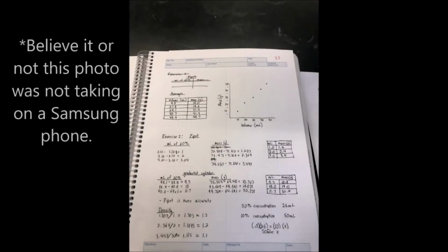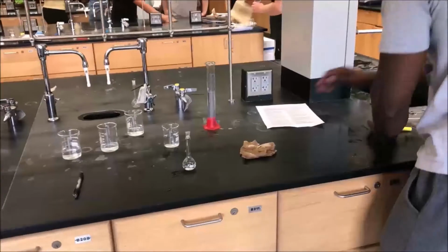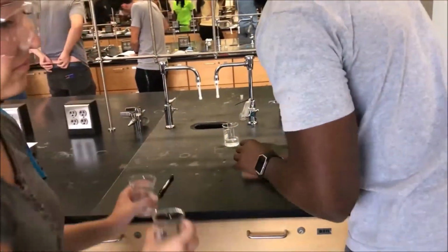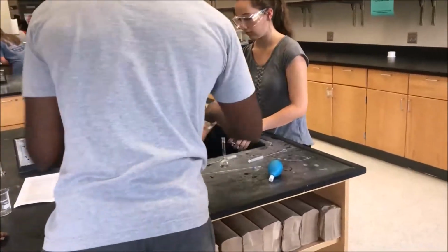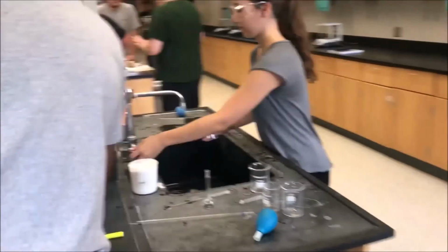In our lab notebooks, we used the dilution equation to determine the concentration of the diluted solution we made. After a long and challenging day in the lab, we used wet paper towels to clean the lab surfaces on which we worked. We also properly disposed of any excess reagent and rinsed out the glassware we used.